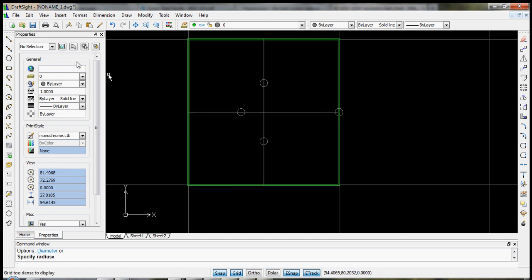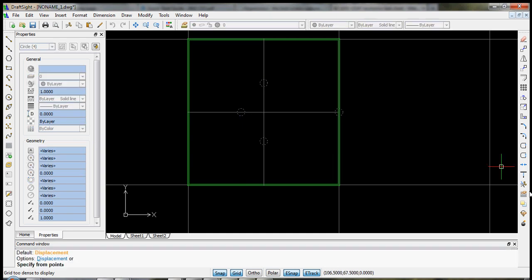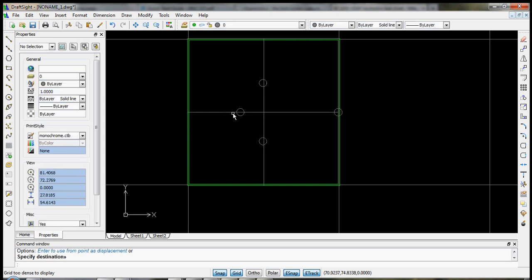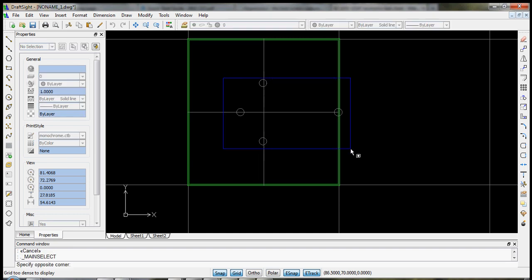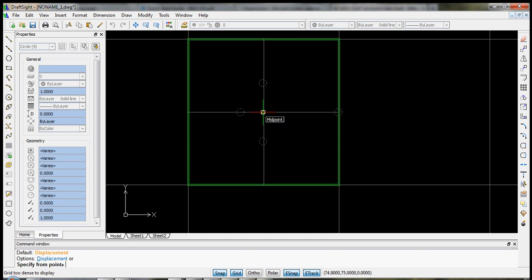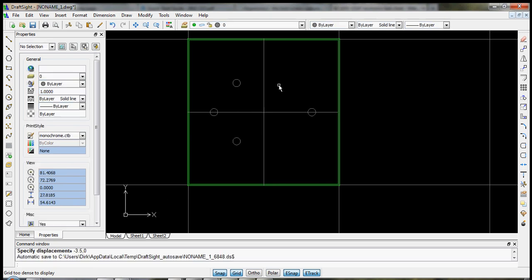As you can see, we're not centered, so we can select these points and we can move them a few millimeters to the side. Okay, let's do M for move, enter, and we will simply displace them. Oops. Let's try it again. Select those 4 circles, move, enter. Displacement will be minus, let's see, 3.5, 0. Alright, so roughly centered now.